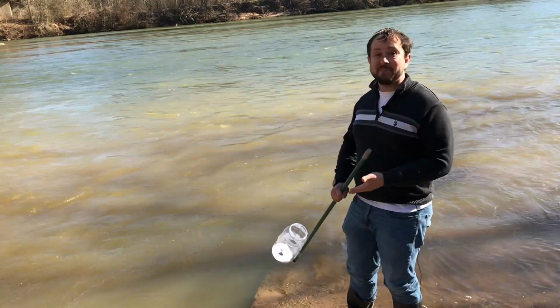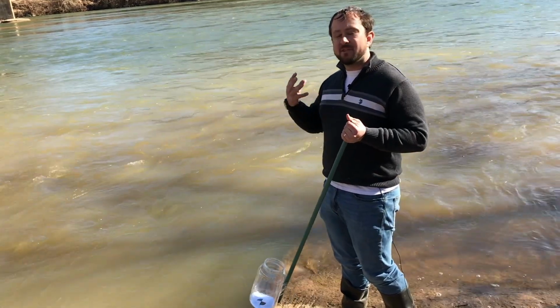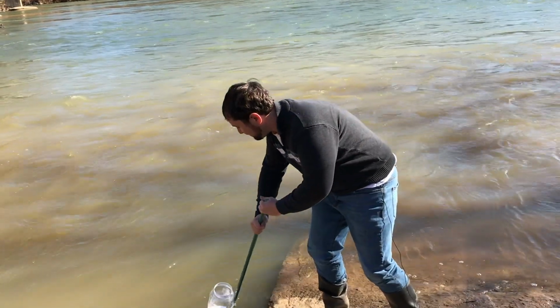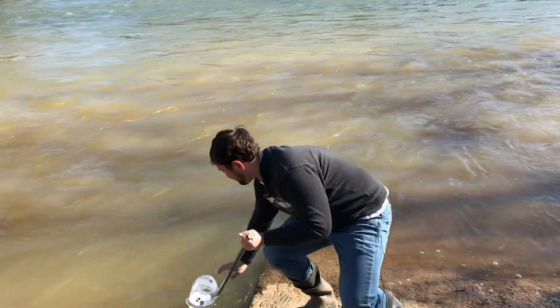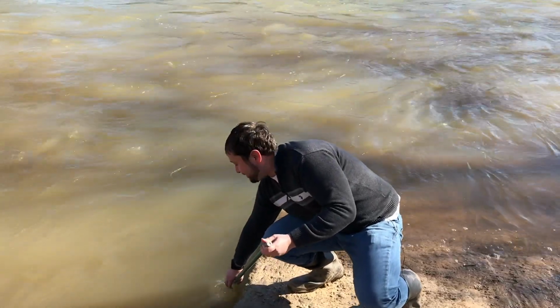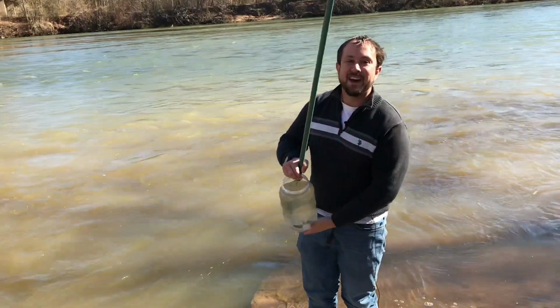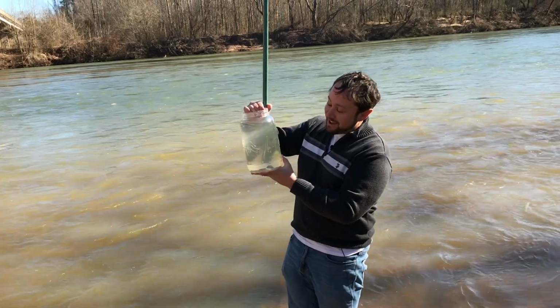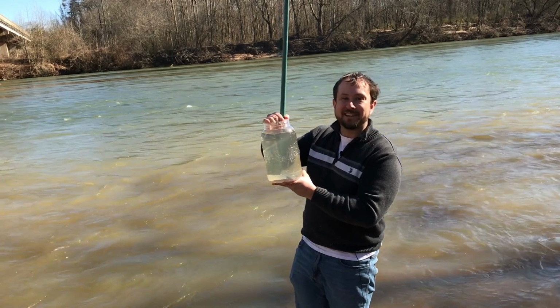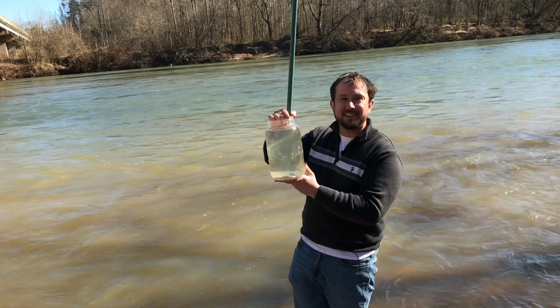Now we're going to sample the Yadkin River here. I've got a nice boat ramp, and the goal is to plunge our sampling bucket in here and pull out a water sample. Sometimes if it doesn't want to pull up right away, you'll have to dip down and grab that, and pour a little bit out. Now we've got our water sample, and you can see it's relatively clear, but there's some opaqueness. We'll compare this to our creek samples and see if we can pull any suspended solids out of this water.